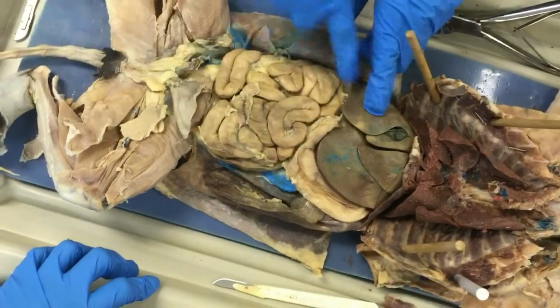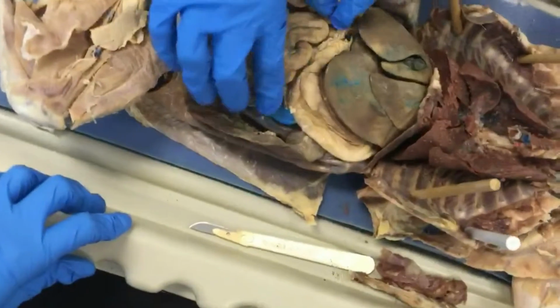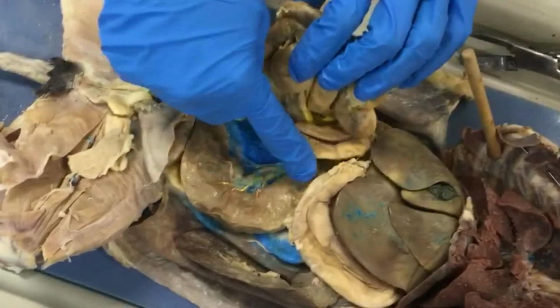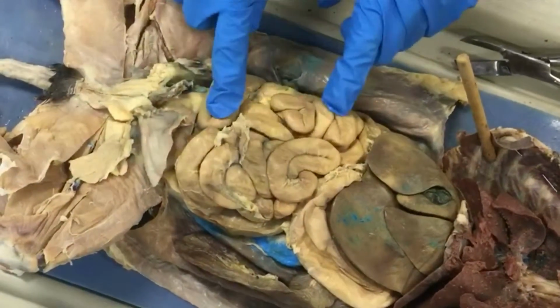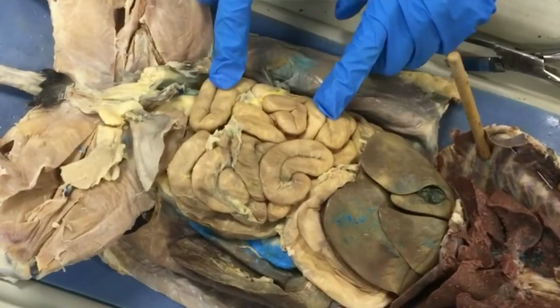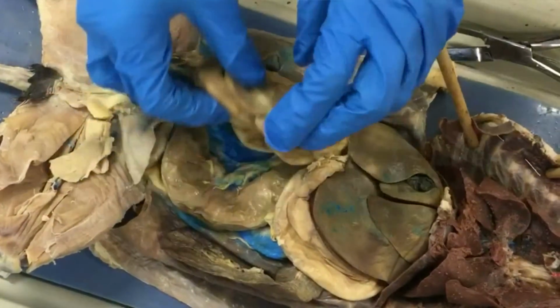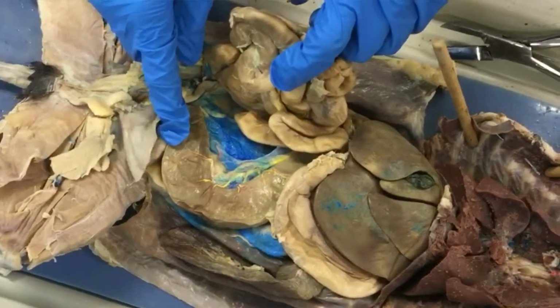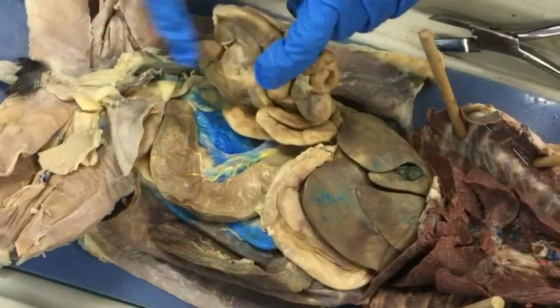Now, as you can see, we've removed the fatty layer, the omentum, and you can see the stomach right here, which is connected to this right here. This is the small intestine, and underneath you can see the short segment right here is the large intestine. The small intestine does 90% of all digestion and absorption of nutrients and minerals from the food. And then the large intestine absorbs water from the remaining indigestible food matter and transmits the waste from the body.